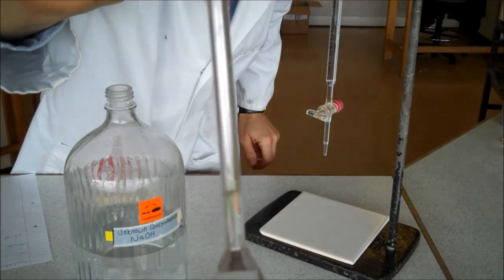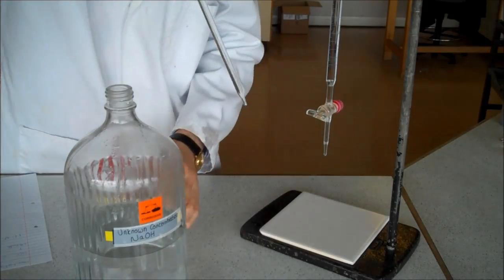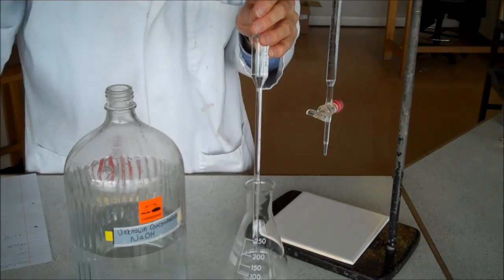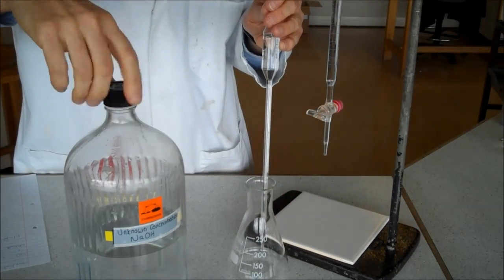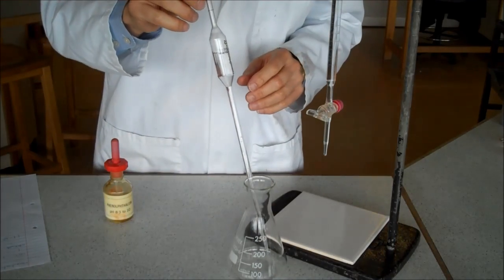I don't know if the camera can focus there and see that, but I'm now going to put my carefully, accurately measured volume of alkali into a conical flask. So, I know how much alkali is in there.